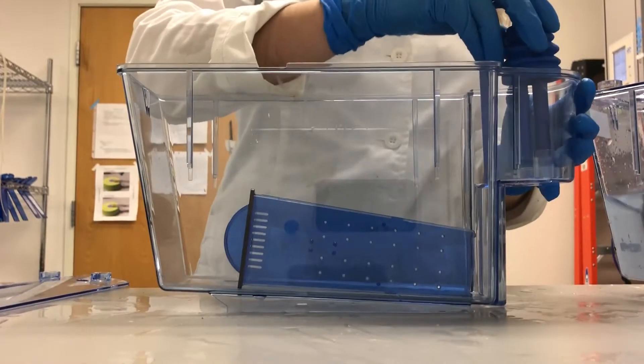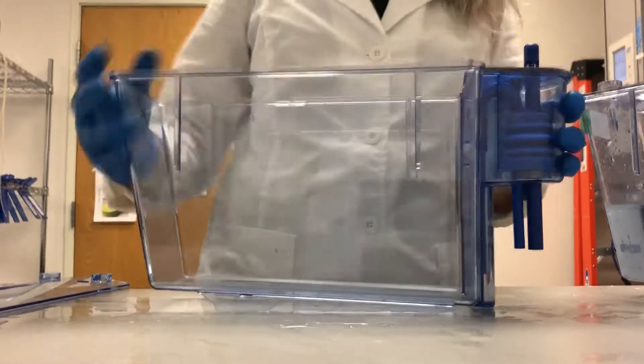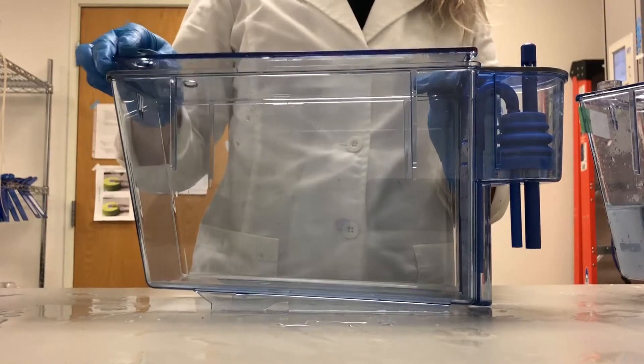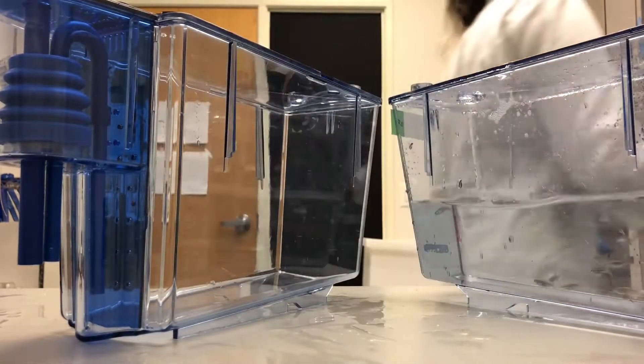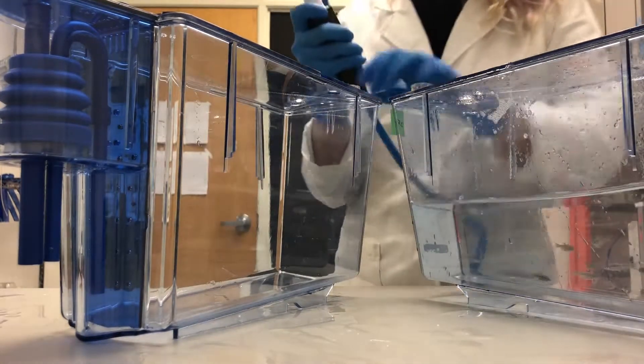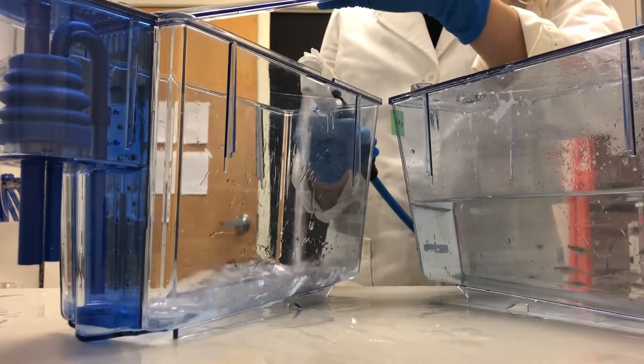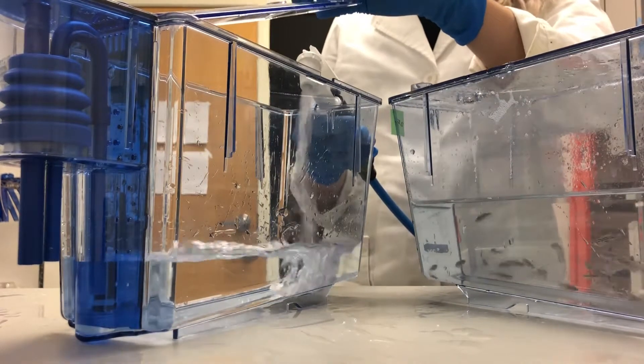First we have to get our supplies ready to set up a new tank. We fill up a clean tank using fish water from the rack.